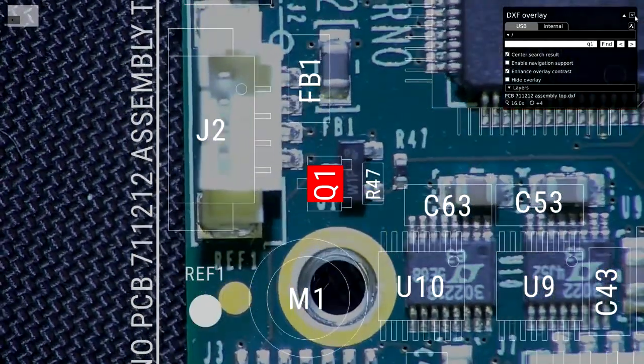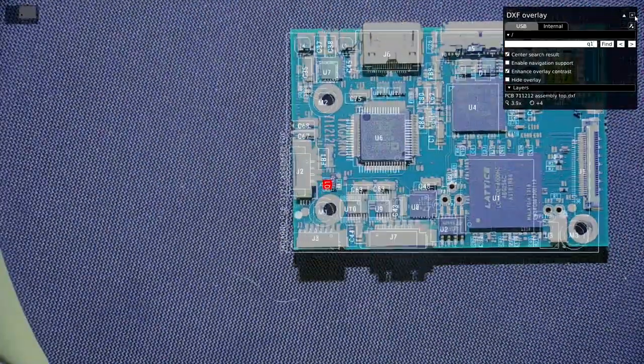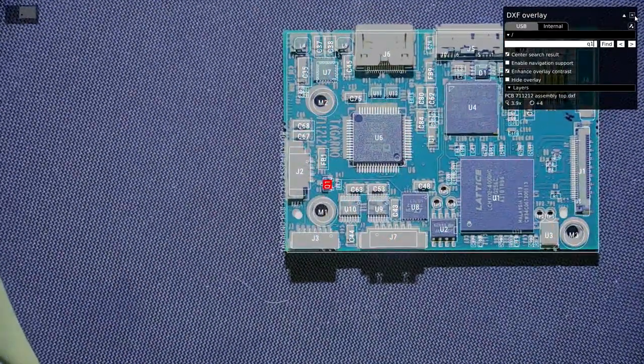So that's my presentation for today. I hope that has given you a good idea of some of the capabilities of the new digital microscopes with all this power built in now, and I'm sure that over time it's just going to get better and better. So we'll see fewer and fewer old analog microscopes.